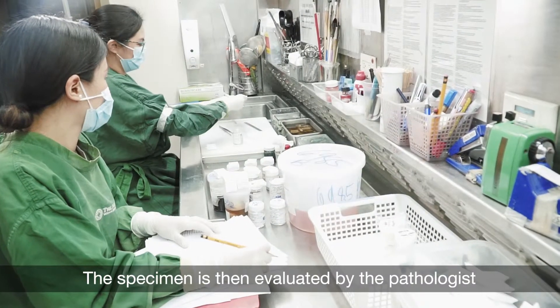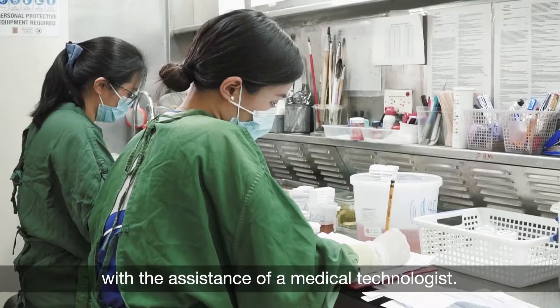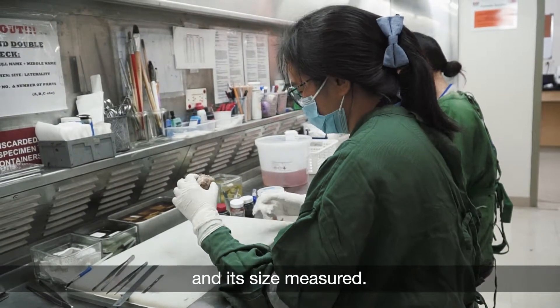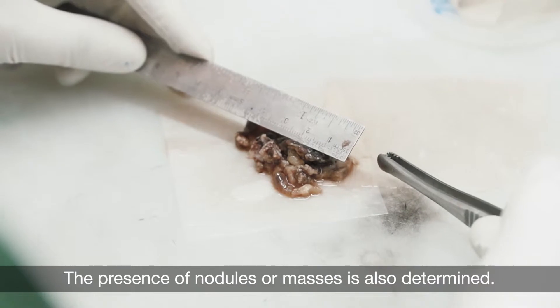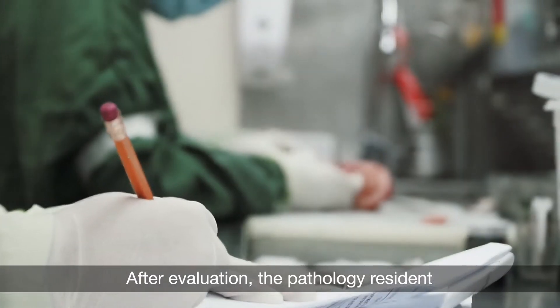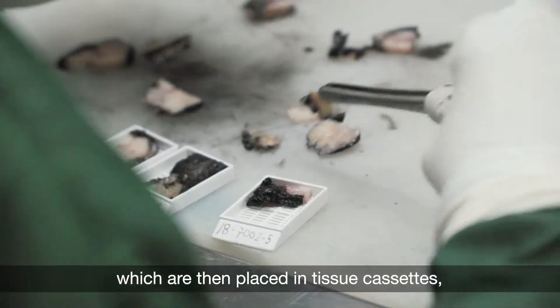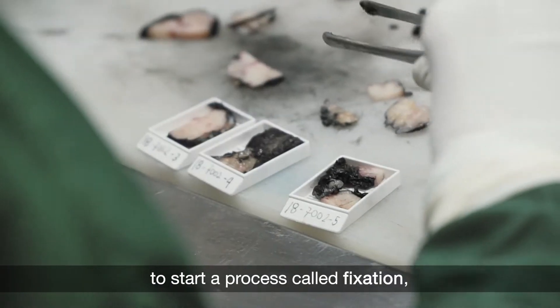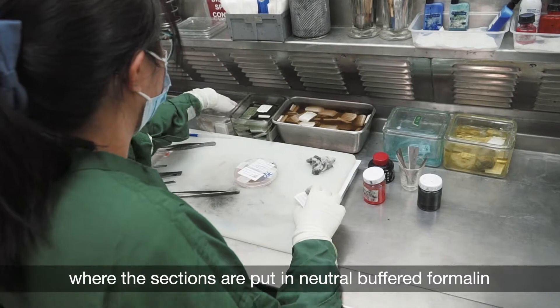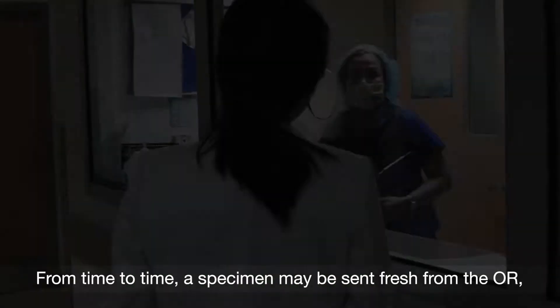The specimen is then evaluated by the pathologist and/or the pathology resident with the assistance of a medical technologist. The specimen's color and texture is noted and its size measured. The presence of nodules or masses is also determined. After evaluation, the pathology resident cuts the specimen into sections which are then placed in tissue cassettes to start a process called fixation, where the sections are put in neutral-buffered formalin to prevent further tissue breakdown.